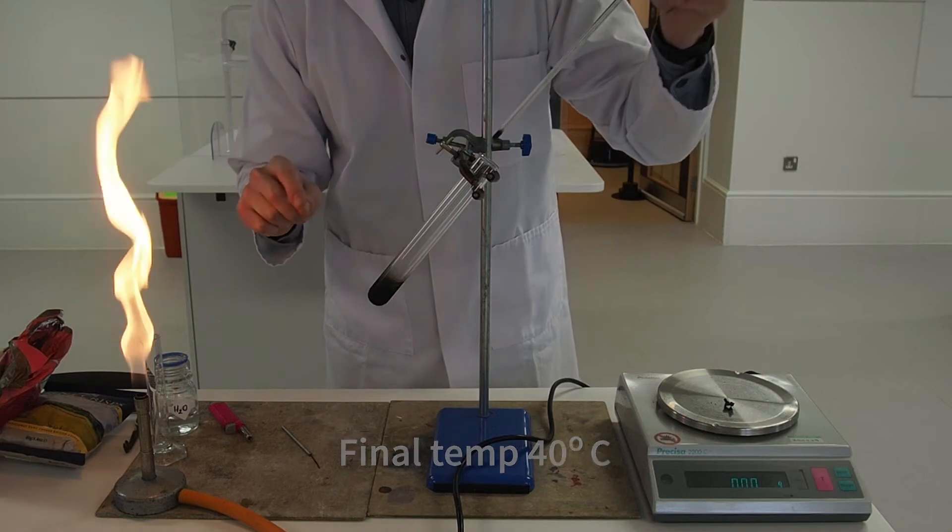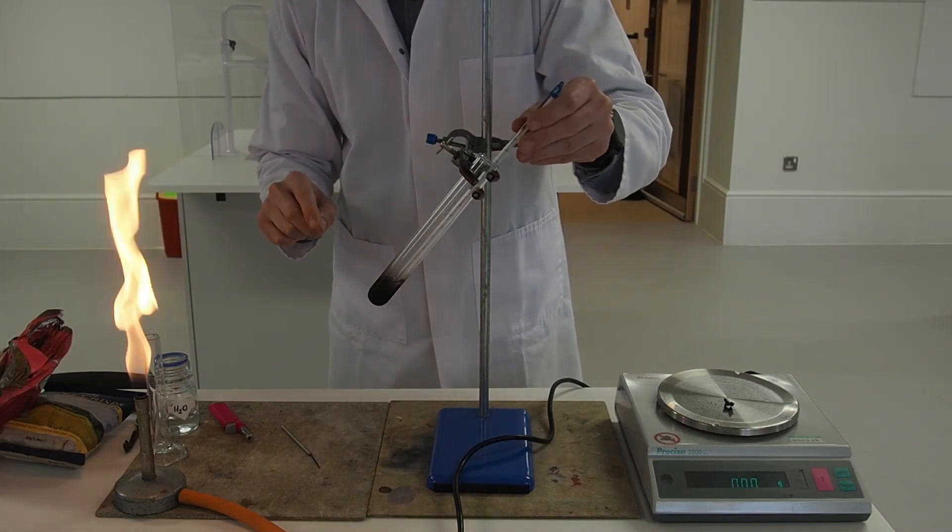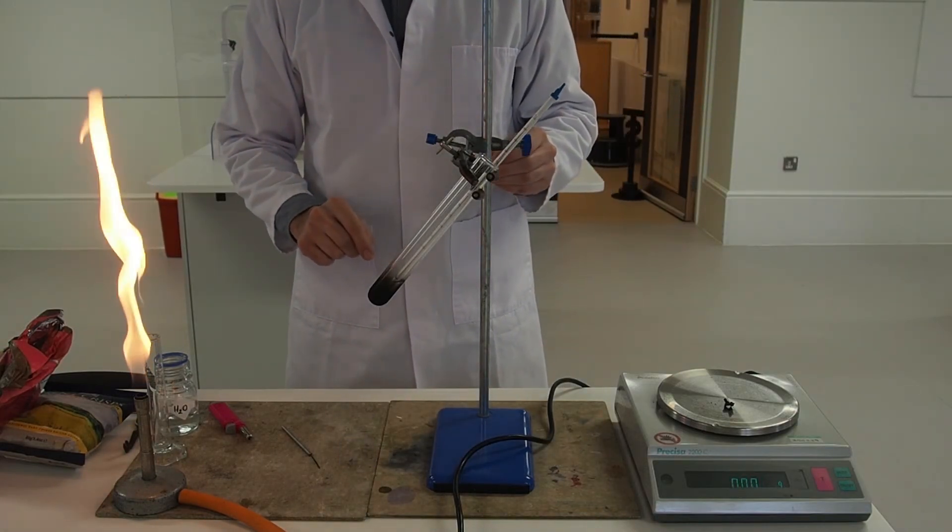The food, there was so little left that it hasn't registered on the balance. You can see the balance is showing zero so we've effectively burnt all of it.